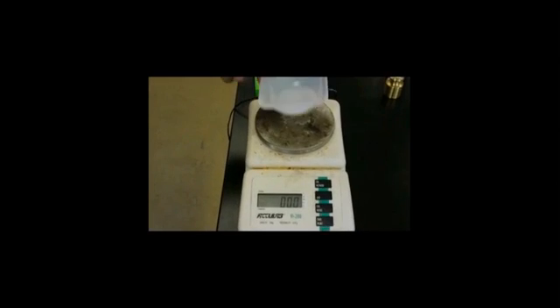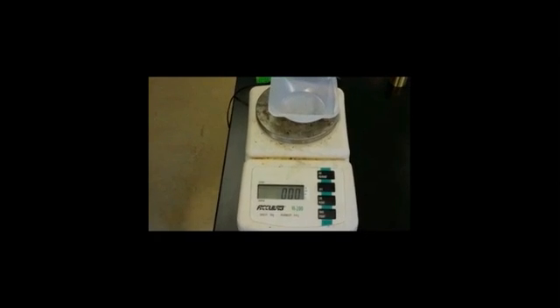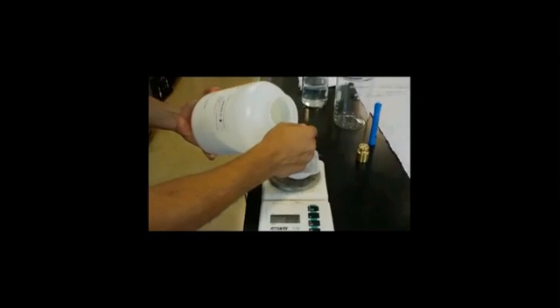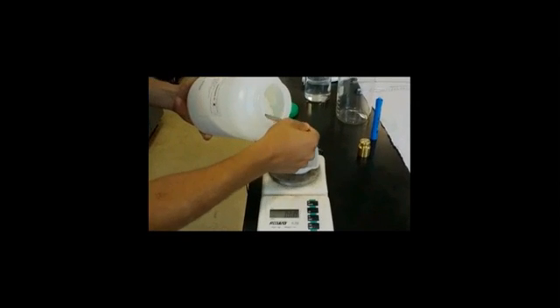Now, if you are going to use any sort of powder or any type of chemical that comes in pellets or powders, you want to use a weigh boat, this clear plastic container. And once you use that weigh boat, you want to zero out, just like how we did in the beginning, so that it doesn't account for the mass of the weigh boat. And then you can pour the reagent in.